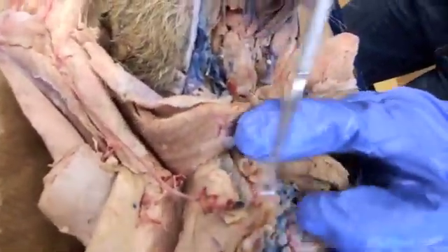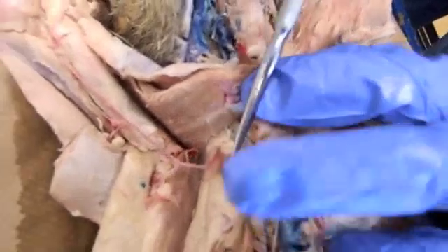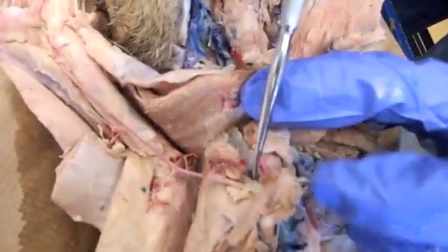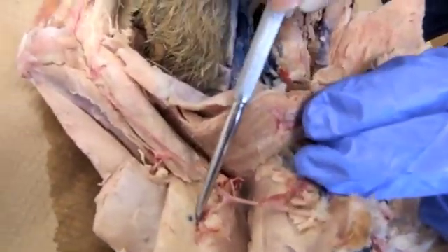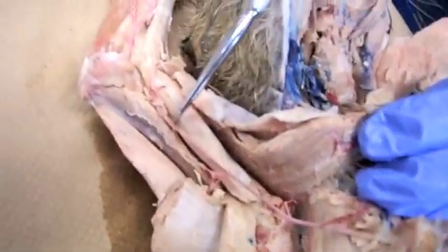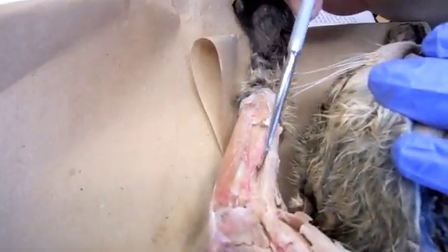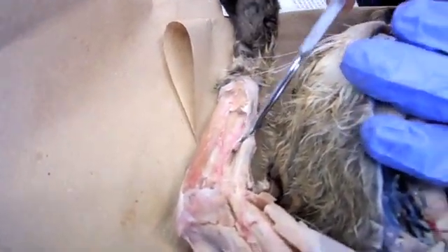You have your subclavian and your axillary, subscapular, brachial, ulnar, and radial. You'll also have to do the left side and distinguish left from right.